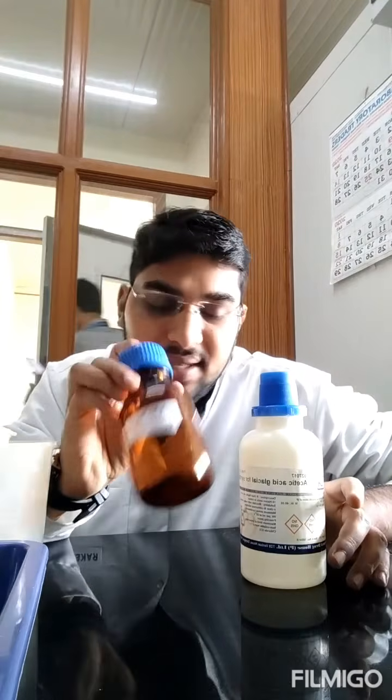If you have seen my other videos, I use all Eppendorf tubes to conserve chemicals. I don't do it in test tubes, so that is why all the chemicals are reduced in my protocol. If you take ninhydrin reagent and acetic acid, it should be equal. If you take 1 ml of acid ninhydrin, you have to take 1 ml of acetic acid. Because here also you are using acetic acid, the pH will reduce.